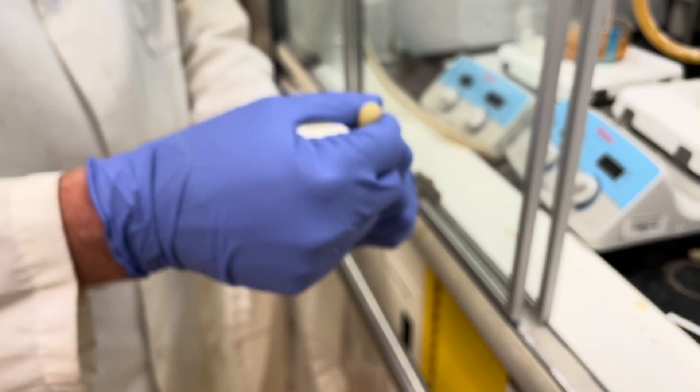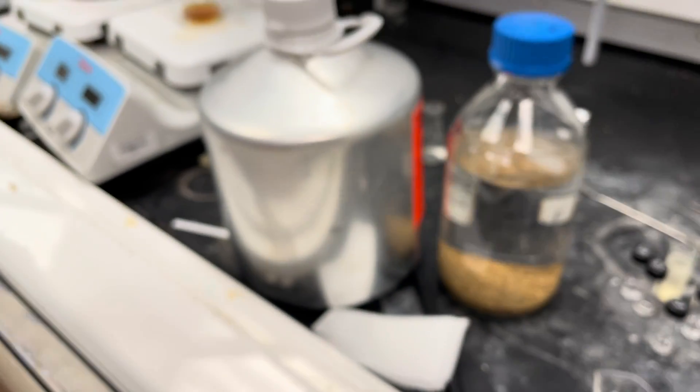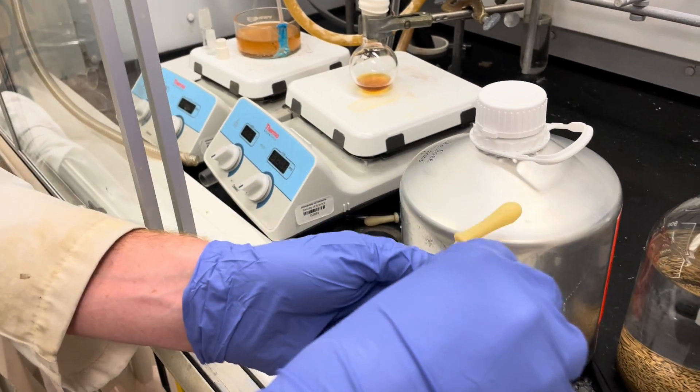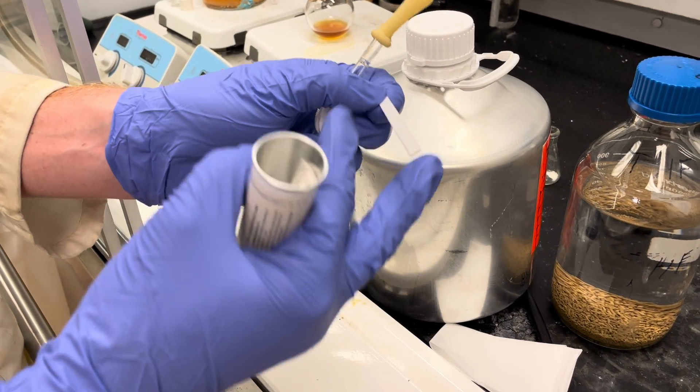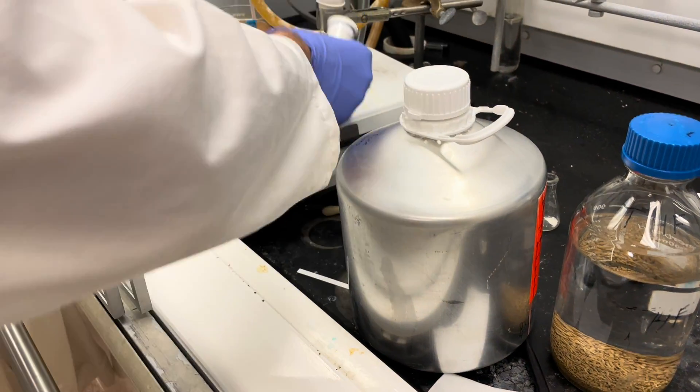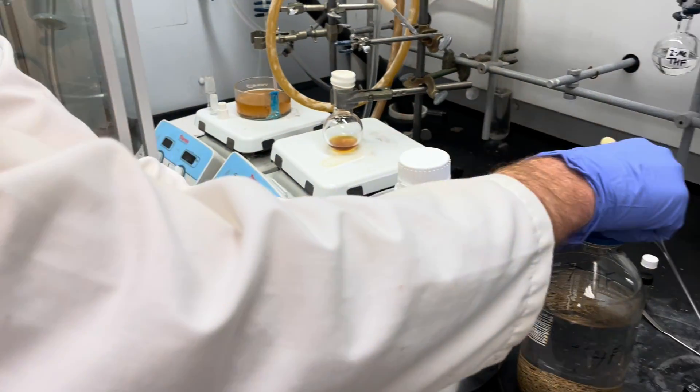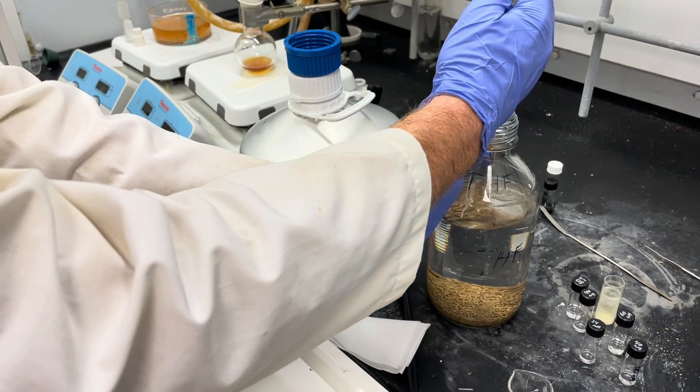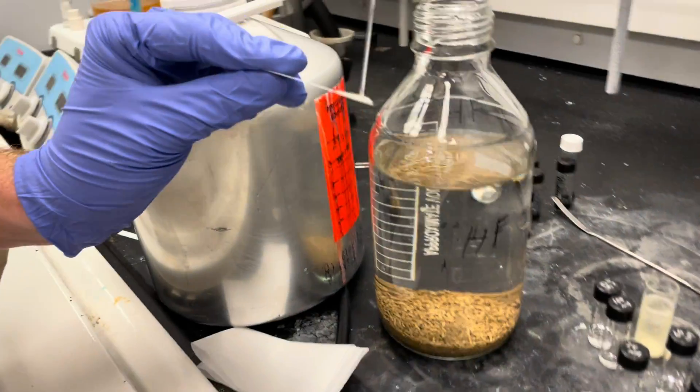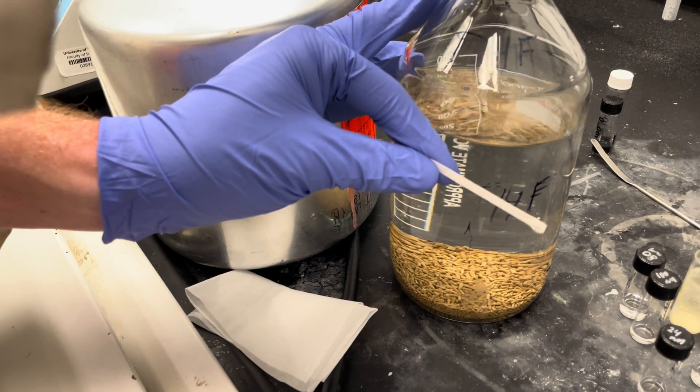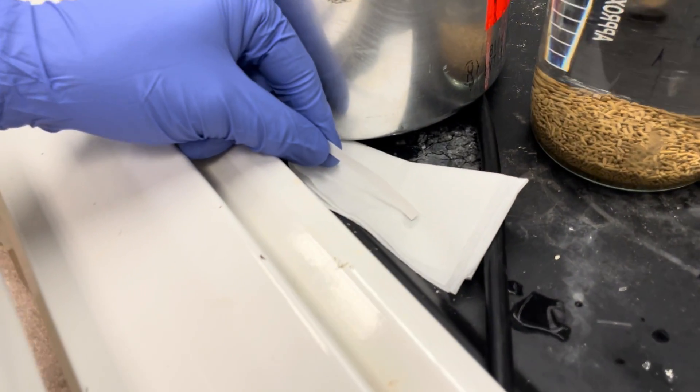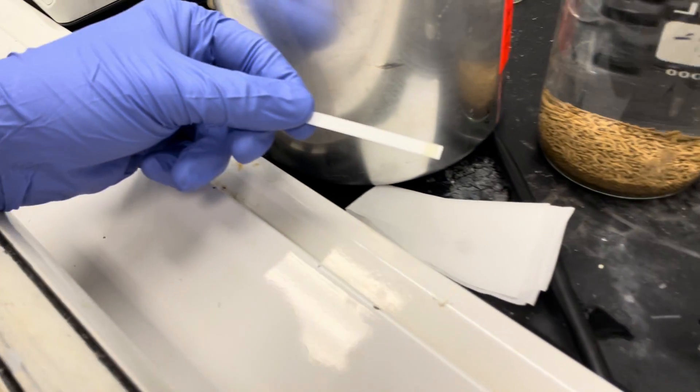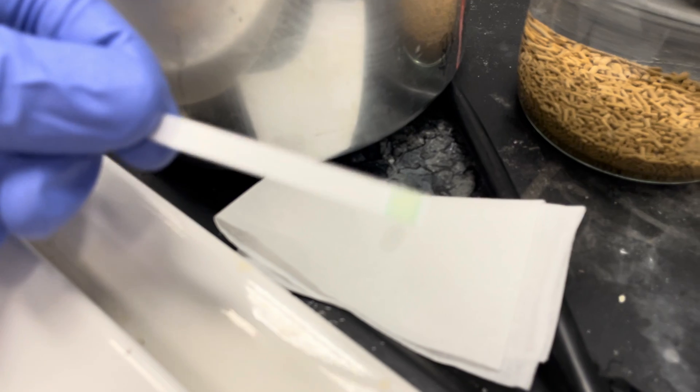Now we're going to test our tetrahydrofuran. With solvents that are less volatile, it's often good to wick them away with a kim wipe before you dip them into the water. Now we'll wait for 15 seconds again and see what's going on.